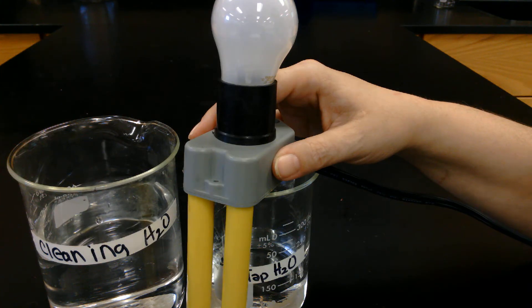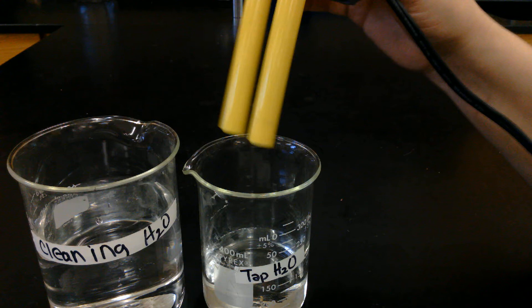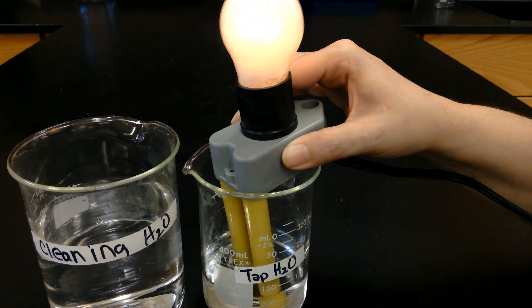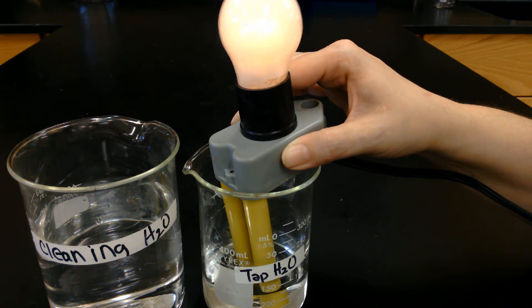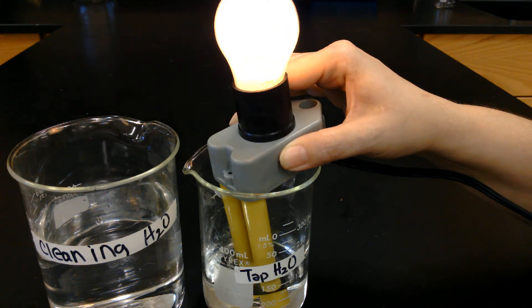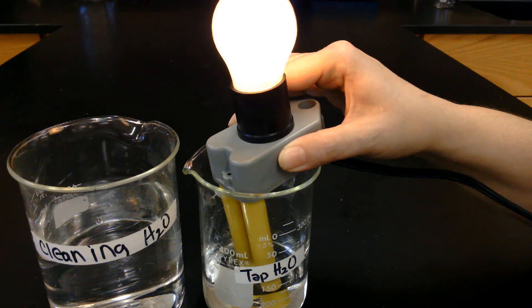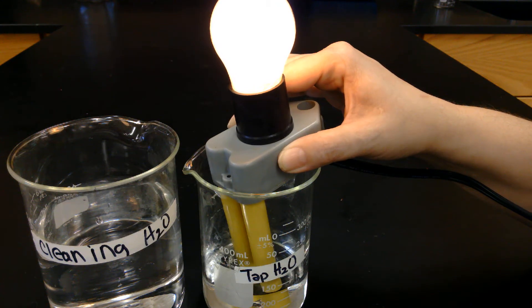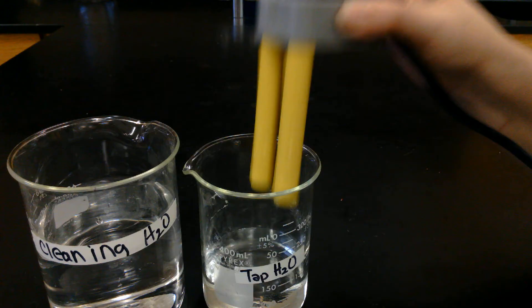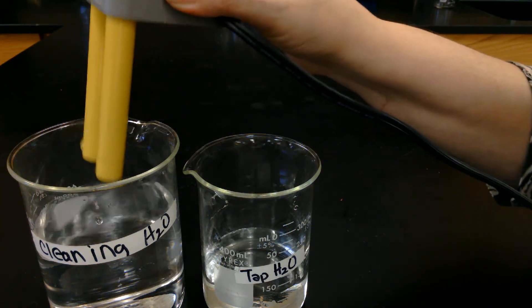We're going to test our first solution, which is tap water. Go ahead and make your observation. Then we're going to clean it off in the cleaning solution, which is just water.